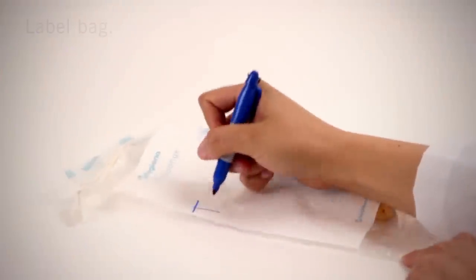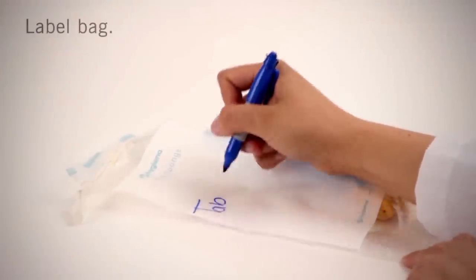Now we will cover stick sponge. Label the sample bag with permanent marker for identification.